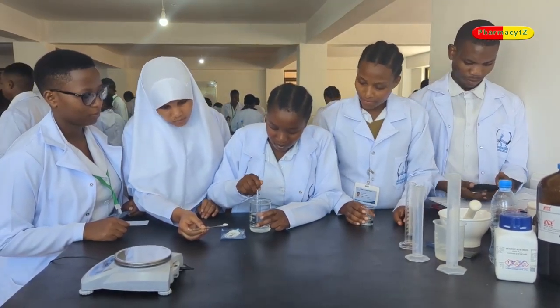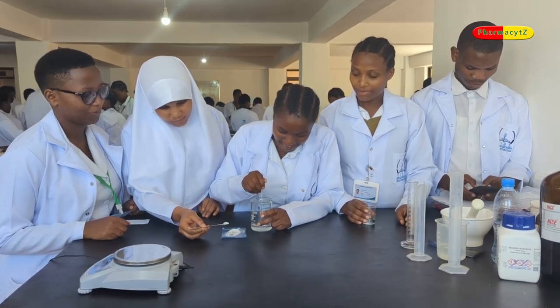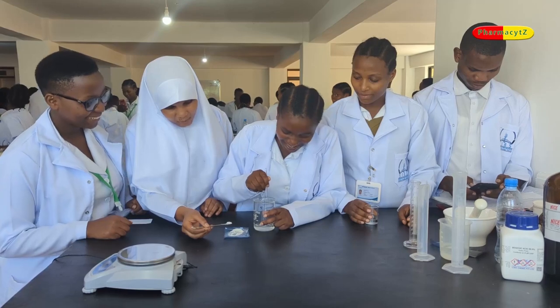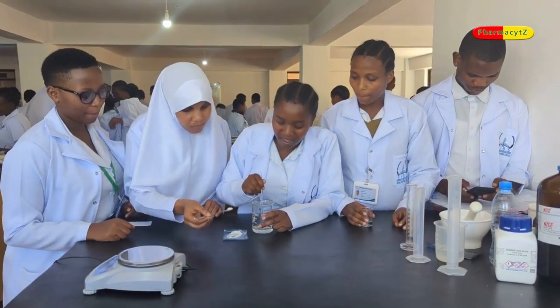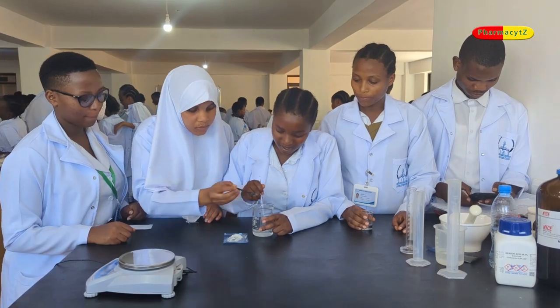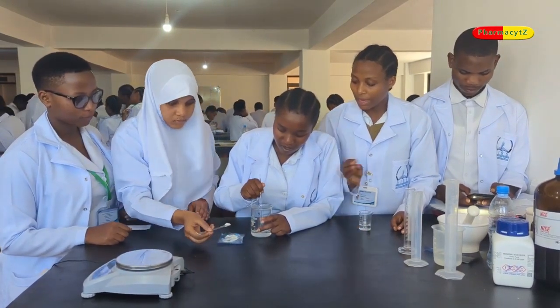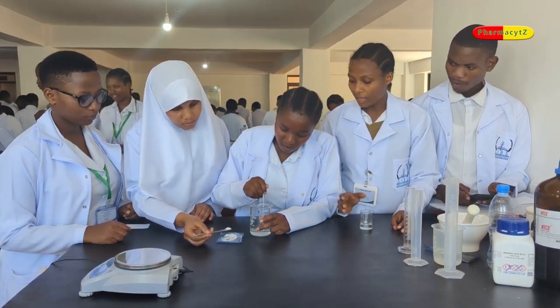When it's done, shift to the measuring cylinder and add water portion-wise. So the same principle applies to water as you did to benzoic acid in propylene glycol. Then while adding water in this solution, it has to be added portion-wise. Now, if you don't put it portion-wise, your preparation will crystallize.